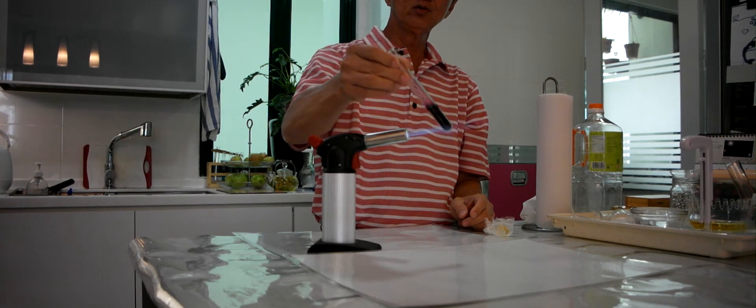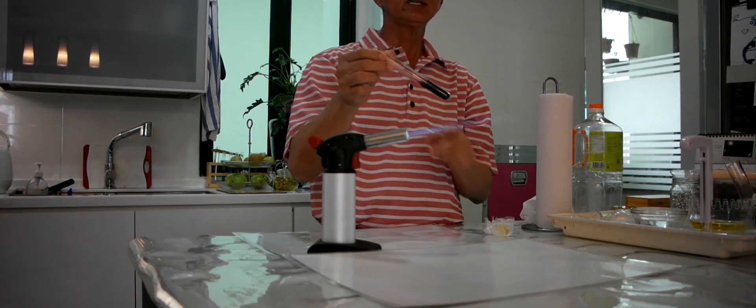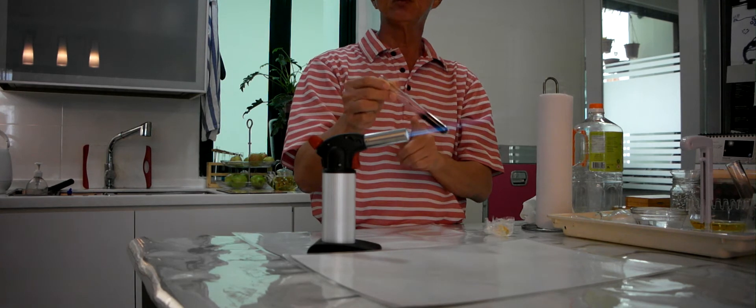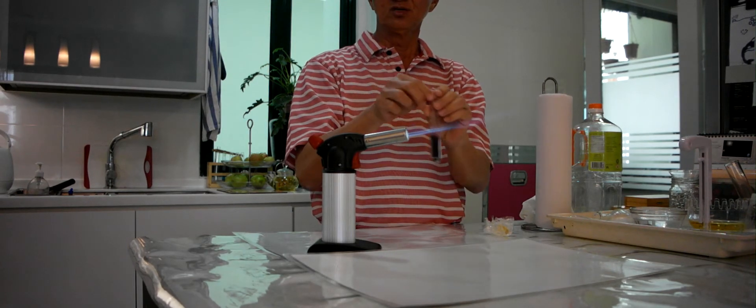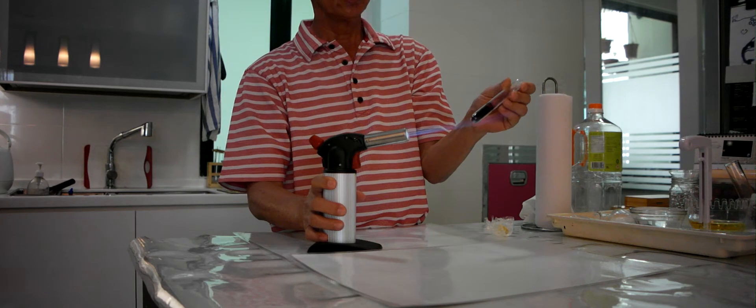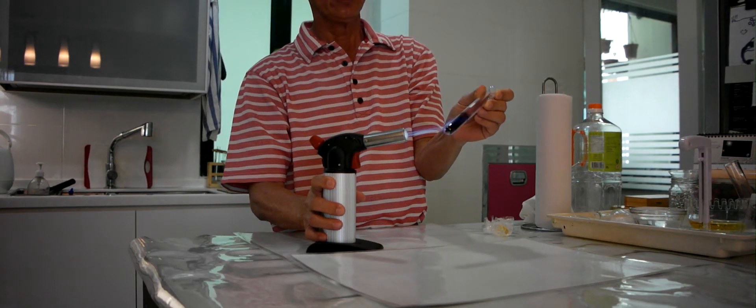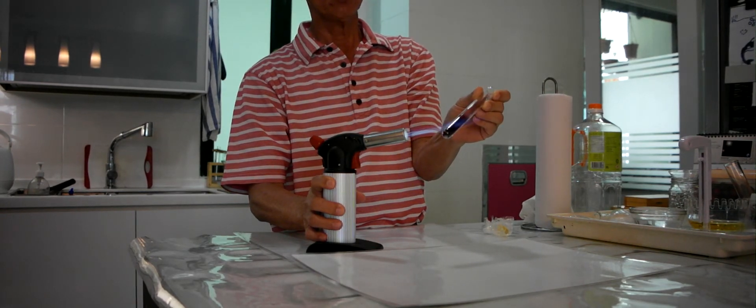But what you don't see is the iodine has to melt first before it sublimes. So now we let this cool. We find that the iodine will sublime on top.